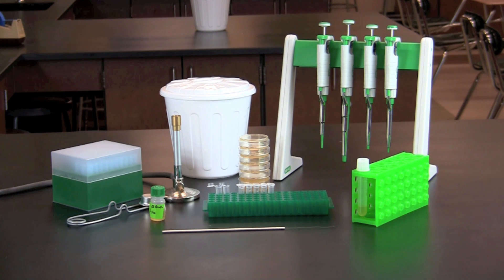In this video you will learn how to quantify the concentration of bacteria in a culture using the serial dilution and plate count method.